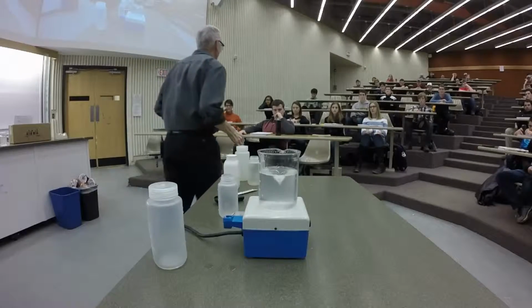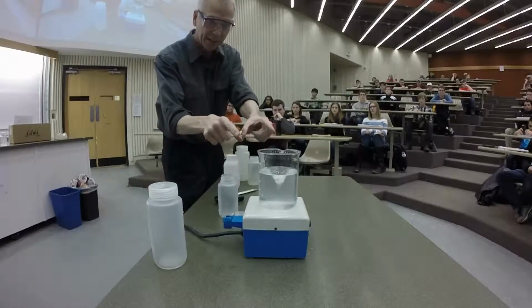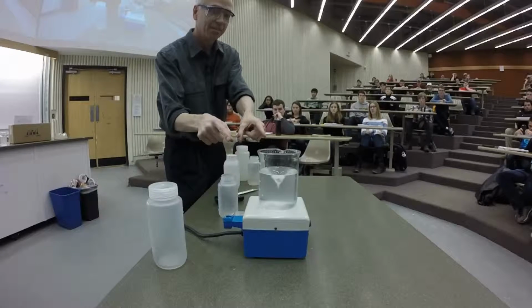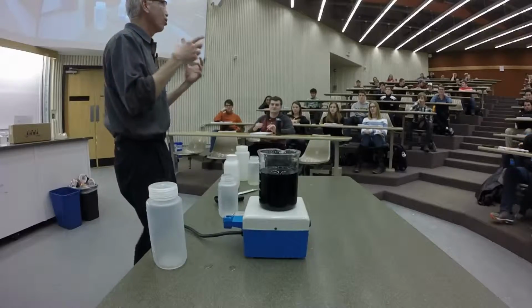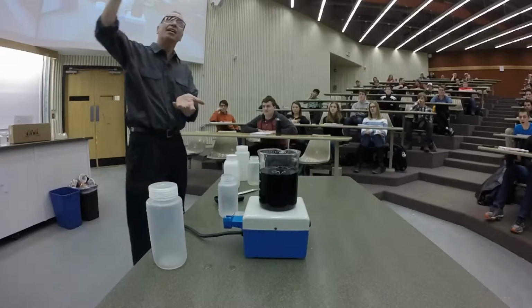3, 4, 5, 6, 7, 8, 9, 10. There's my 10 seconds. And there we go. Obviously, it took longer. It took longer with the lower temperature than with the higher temperature.